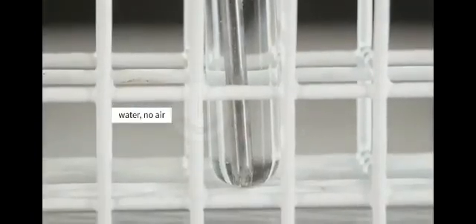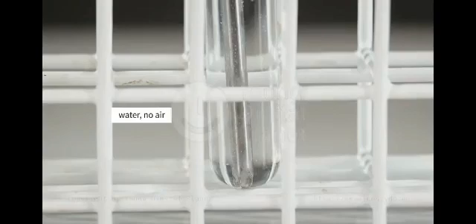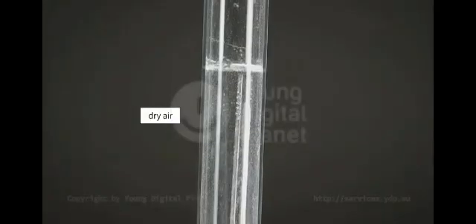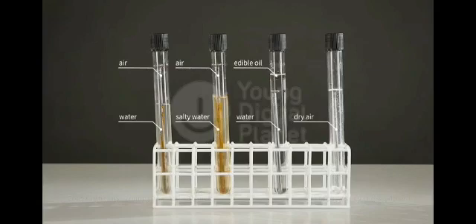However, no rust formed in the 3rd and 4th test tubes. In the 3rd test tube, the nail was in contact with water, but there was no access for air. In the 4th test tube, there was no water. It appears that air and water are needed for rusting to occur.